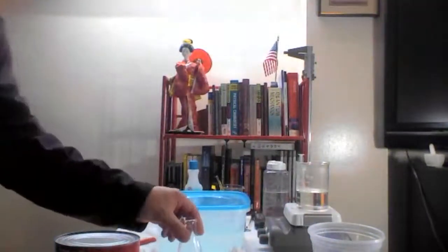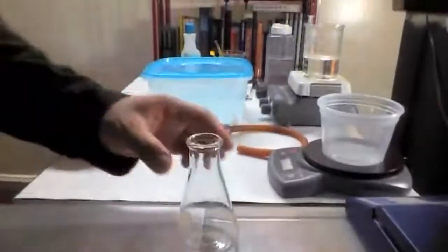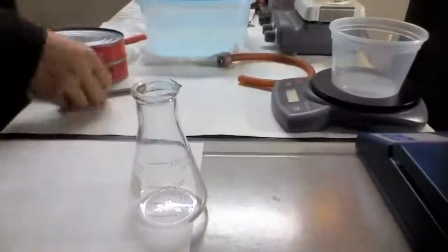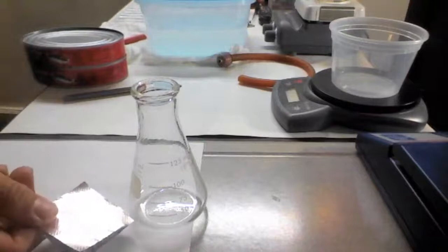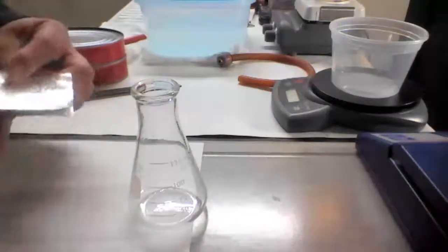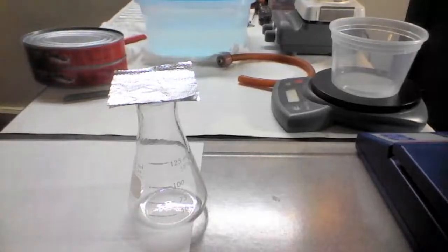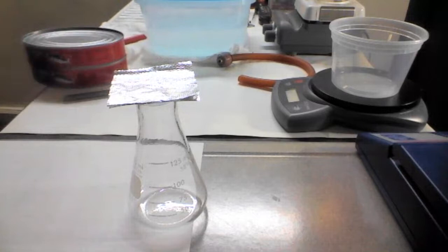We have to find the volume of this. Let me show you. So we need the volume of this flask. For Avogadro's law, the plan is that this is going to be completely filled up with gas molecules at a certain temperature, and the volume limit is set up by this. Okay, so that's the volume limit. You have to fill up this completely to that level, and then write that volume.